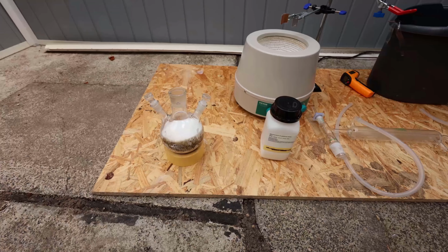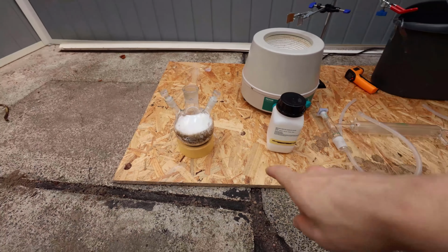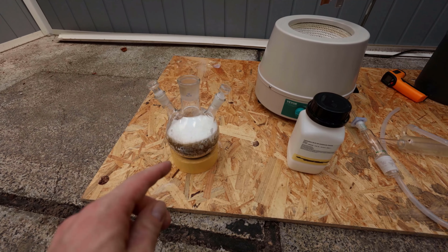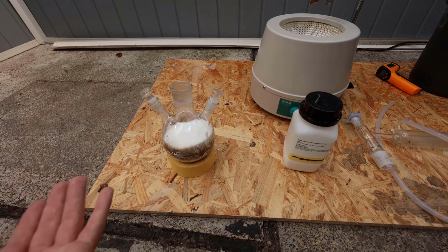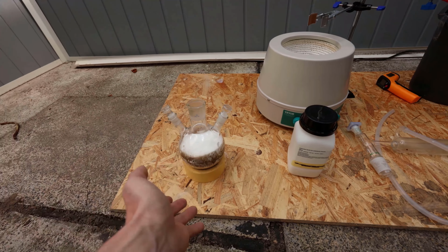Let's see how much I will get when I do the rest of the adipic acid. So I'm processing the rest of the adipic acid right now, and I still have 500 grams left, and this is just too much for this flask. I did order a bigger one, but it hasn't arrived yet. So I can't really do anything but to do this in 2 more batches. A bit annoying, but either I wait for the bigger flask or do it right now. So let's just do it and get this done.